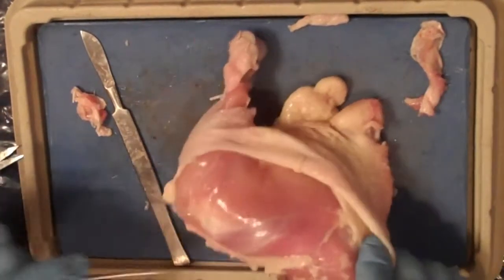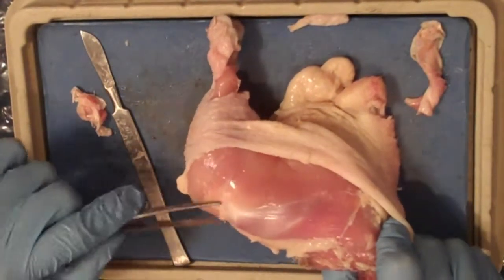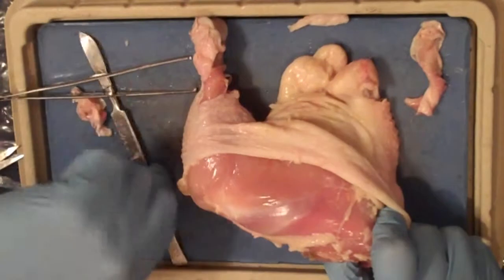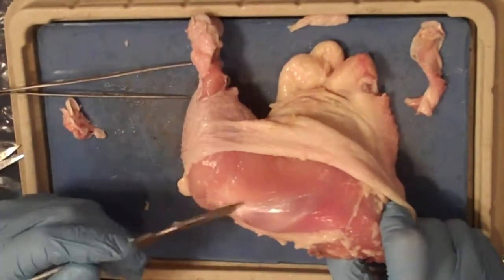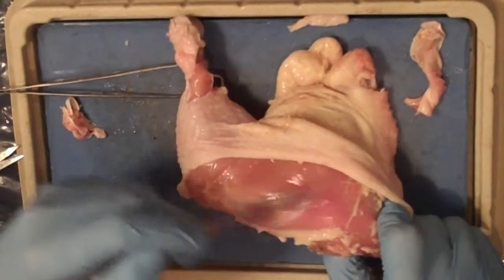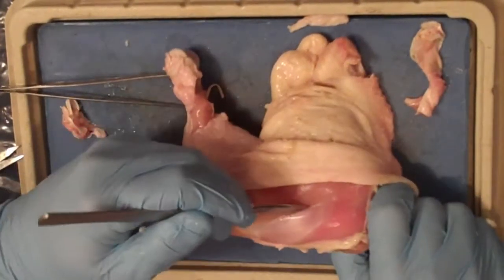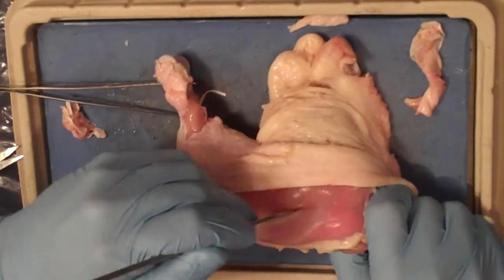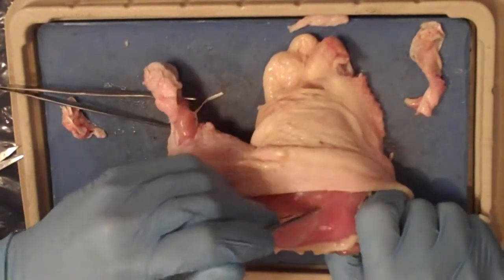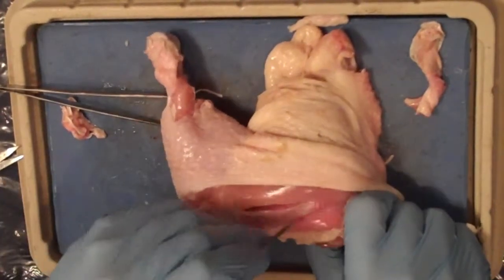Now you're going to want to find the tendon. The tendon appears to be a lighter colored tissue along the muscle tissue. It should be a band or a strip of lighter color. Scrape away any areolar tissue that might be in the location, and then use your scalpel to cut along each side of the band. This should separate the tendon from the rest of the muscle. Now, take your pick or your scalpel and put it underneath the tendon and pull at it.